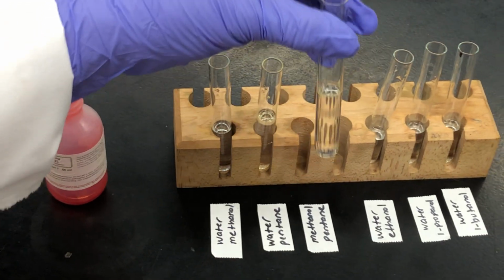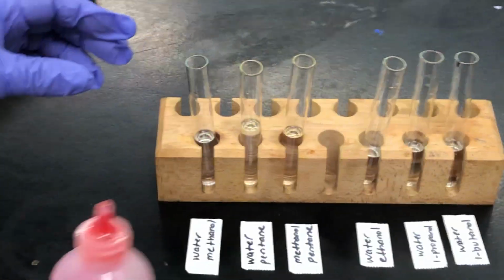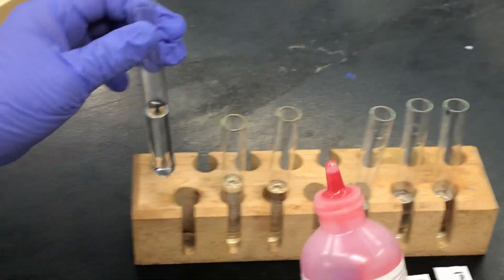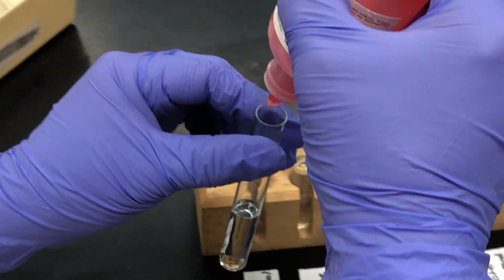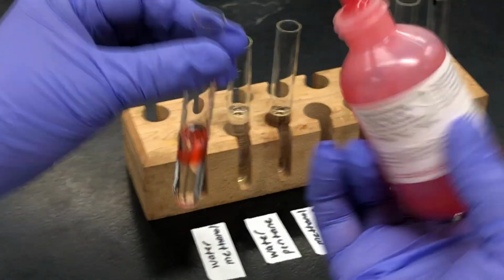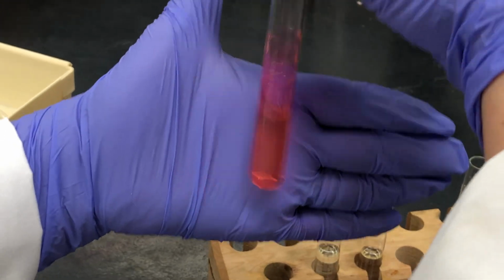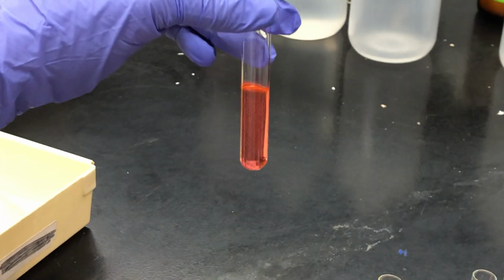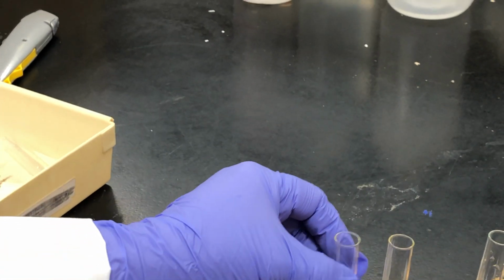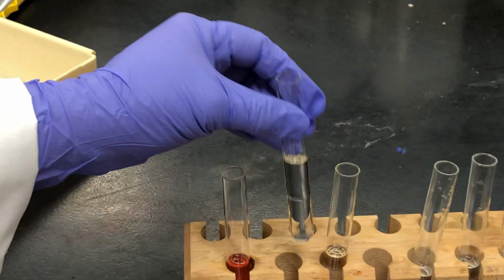Now, these are all colorless liquids, and so in order to visualize the mixing or not of these liquids, we're going to use food coloring. Food coloring, red dye in this case, dissolves very well in water. It's a very polar molecule, it dissolves in water, polar dissolves polar. And so we are now adding 1 or 2 drops of food coloring to the water methanol mixture. We do a little shaking, a little mixing, and you can see that the color distributes really well in the test tube. That means that the two liquids are miscible, it forms a homogeneous solution, and the dye, the red color, is completely distributed in all the liquid.